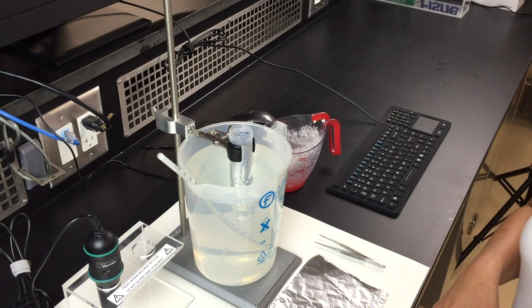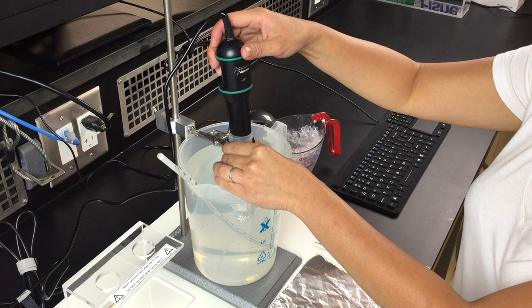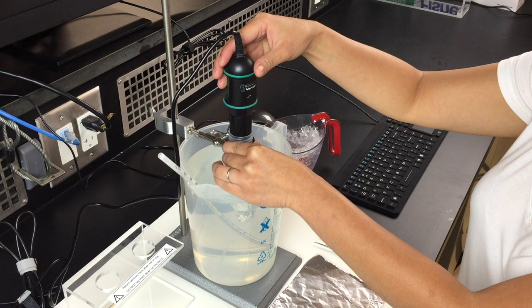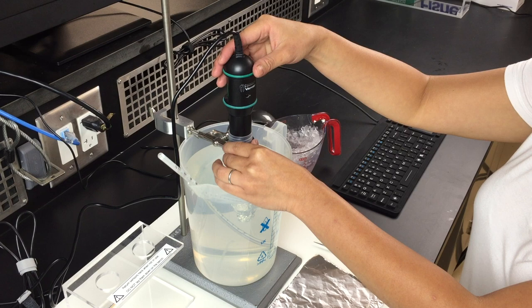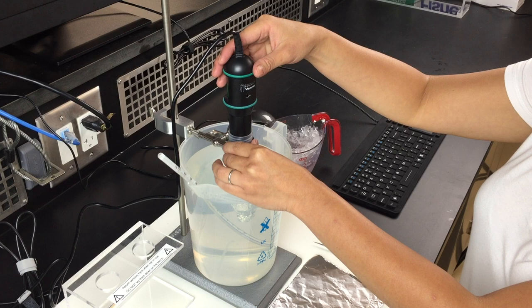At this point, you want to insert your oxygen sensor into the neck of the biochamber snugly. It should fit snugly into the neck. Do not jam that down very tightly.